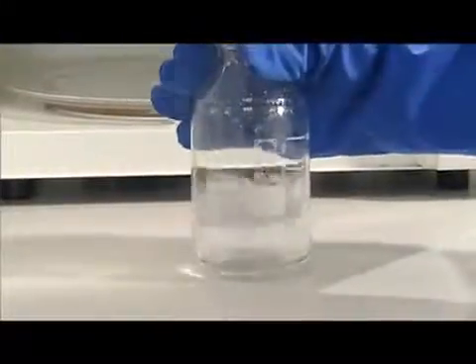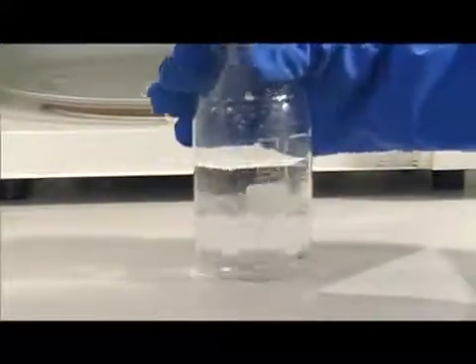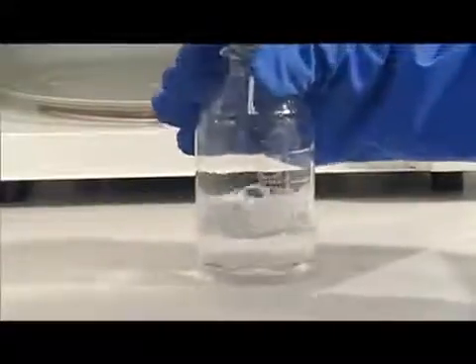Once the agarose is fully dissolved, let it cool to 60 degrees Celsius. This prevents heat damage to the gel tray while keeping the agarose liquid.